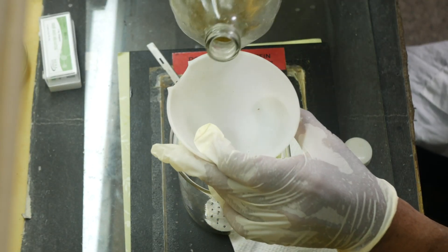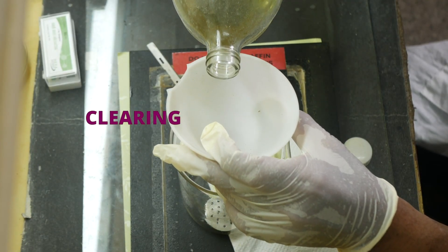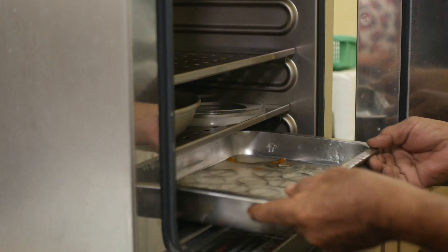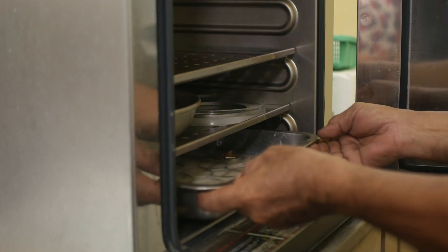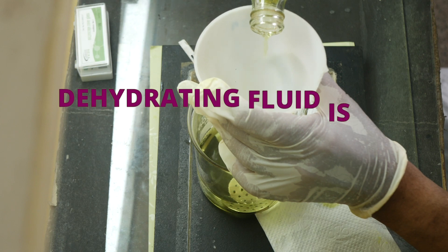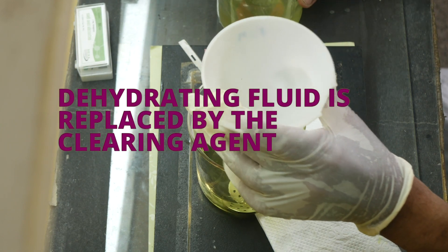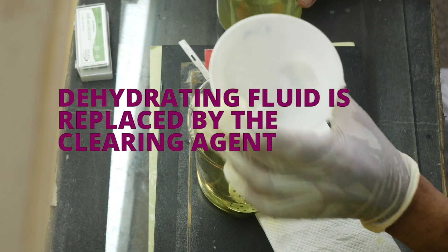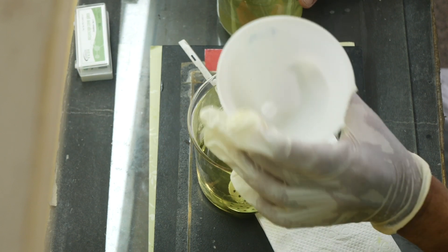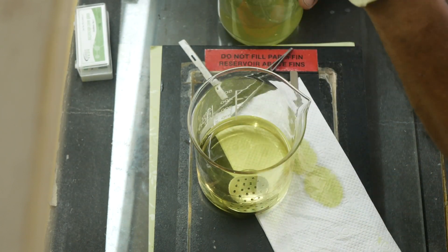After that, we need to remove the dehydrating agent from the tissue samples through a clearing process, before finally impregnating them in paraffin. The dehydrating fluid is replaced by the clearing agent that is totally miscible with both the dehydrating fluid and the embedding medium. For this, we use toluene in the following order.